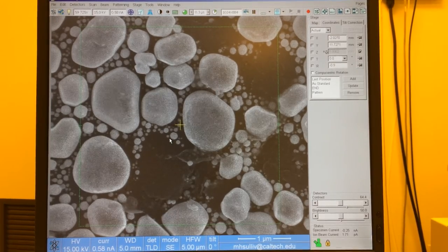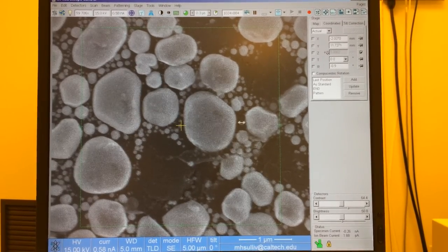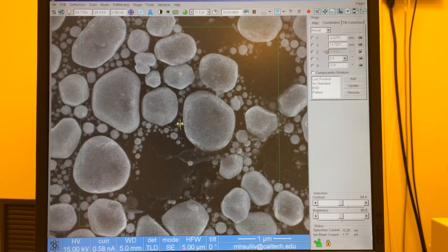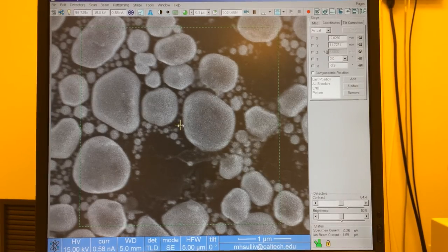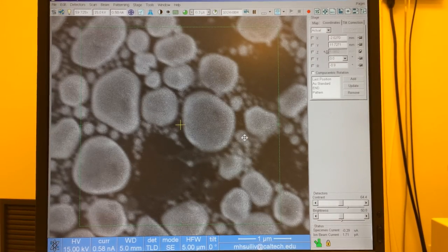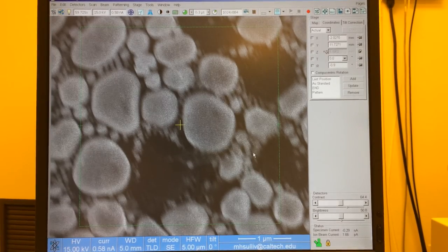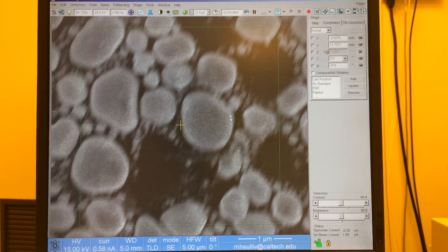Now, I want to show quickly what happens if we don't pick the right focal plane. So, for instance, I'm at pretty good focus in astigmatism here. Now, if I move my focus to the right, for instance, and now I'm trying to fix astigmatism, I'm going to move the focus a little more. If I try to fix astigmatism when I'm not on the right focal plane, all I'm really doing is changing the shape of the ellipse that's contacting the surface. So as I move left and right, you can see I'm inducing a stretching. If I move up and down, I'm just changing the way that that's stretched.